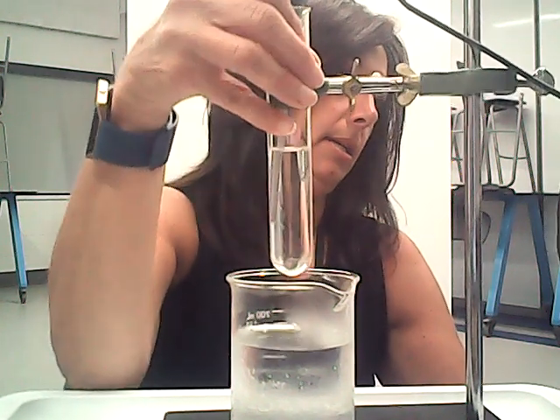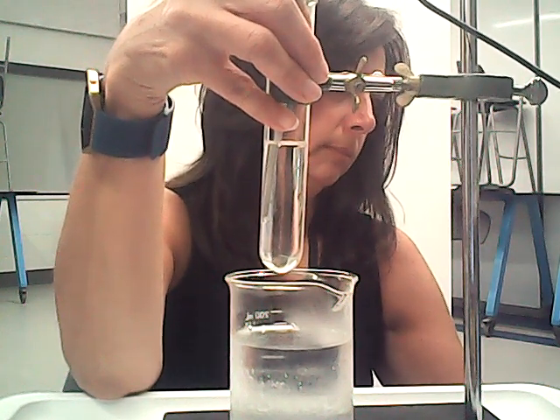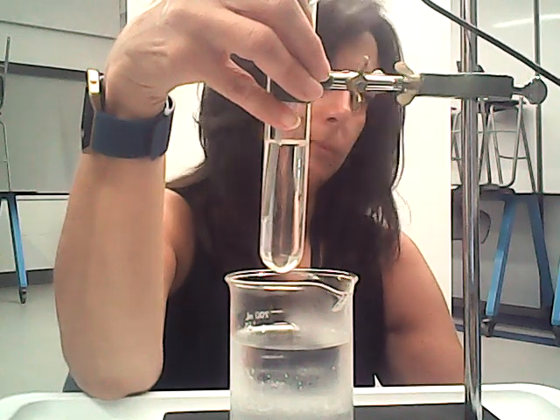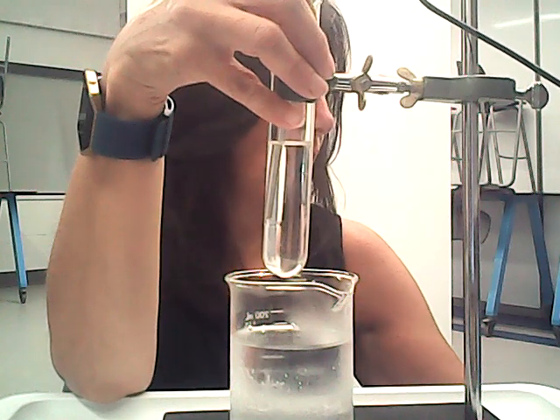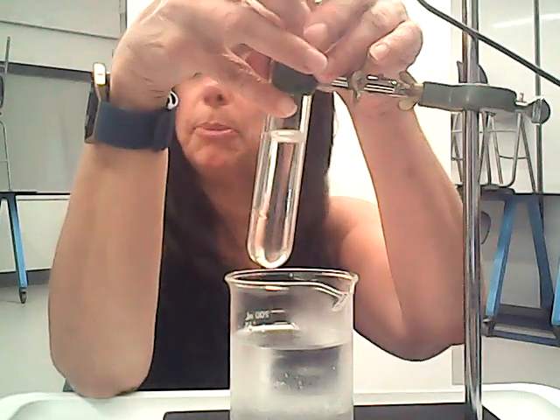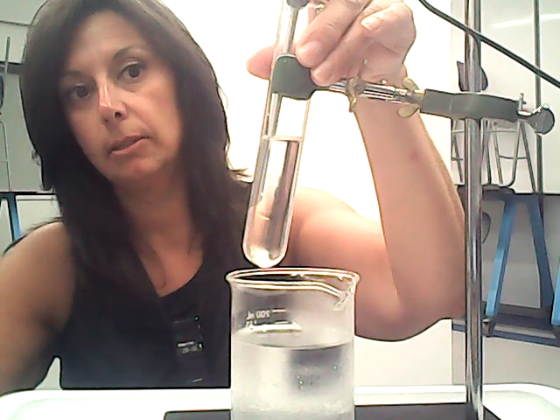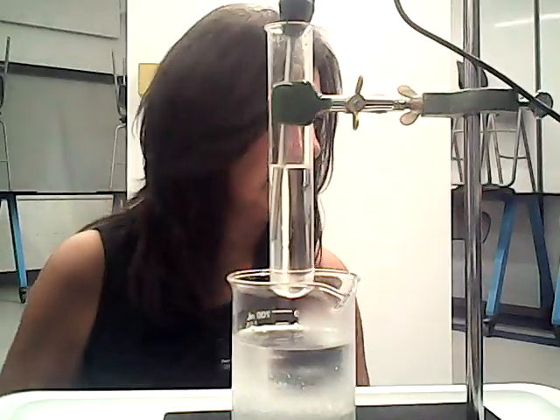Let's start collecting. Well, it's green, so we should have a start temperature. Oop. I'm going to pause the video and see if I can get this to work, and then we'll start up again. All right, we got it to go.